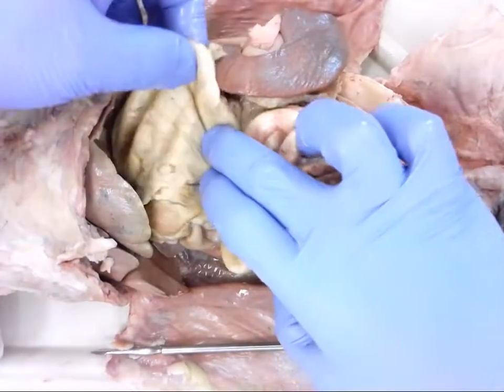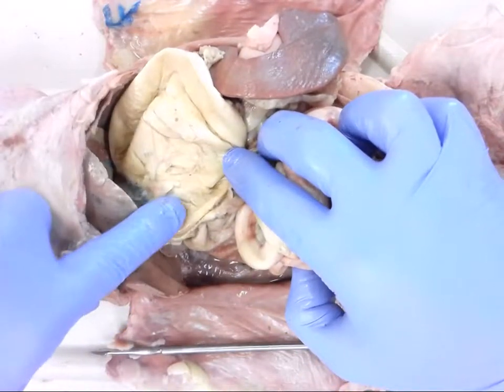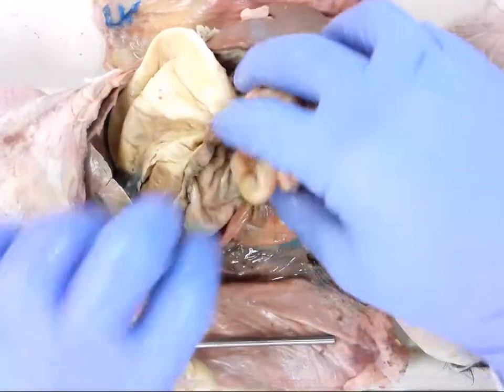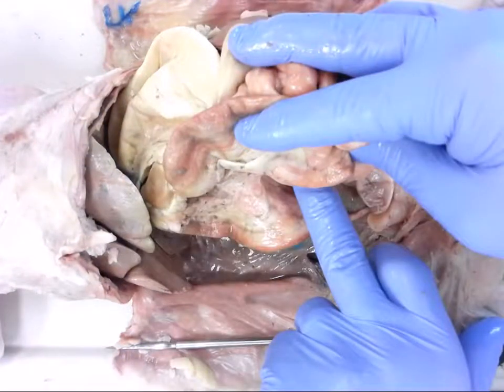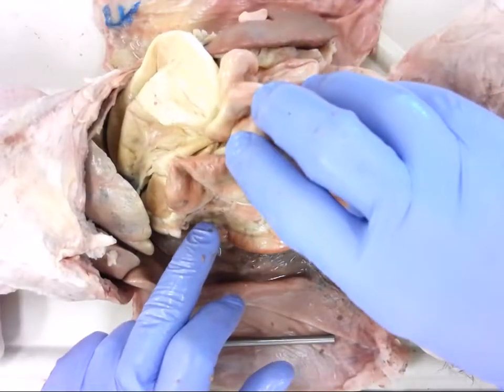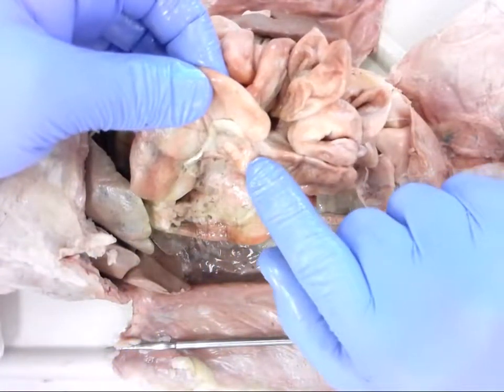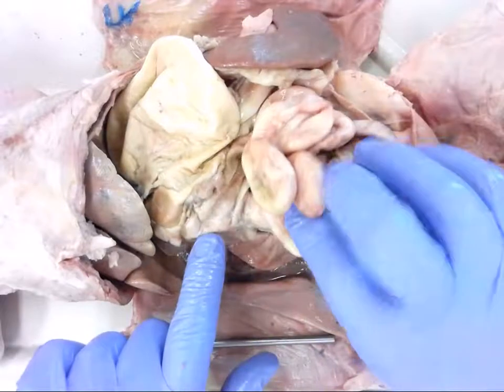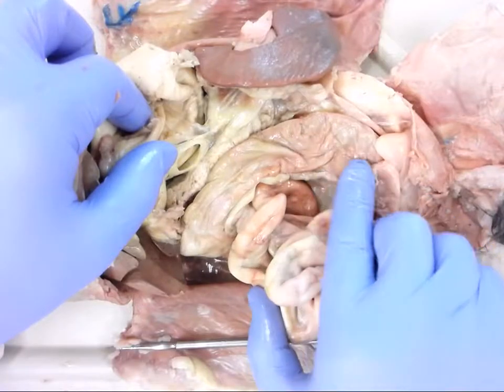Quick review: stomach up top — we have the fundus, the body, and the pyloric region, with the pyloric sphincter. Then the small intestine with three components: the duodenum, which comes down and angles up becoming the jejunum, and eventually the ileum. The ileum then works its way into the large intestine — the colon — with the ascending colon, transverse colon, and then the descending colon as it works its way around.